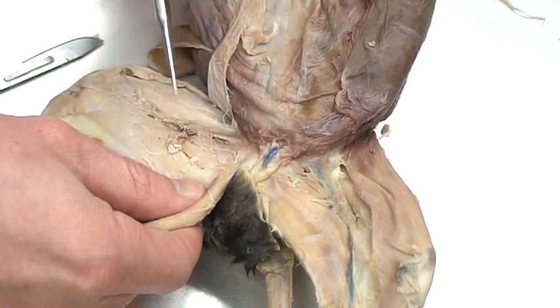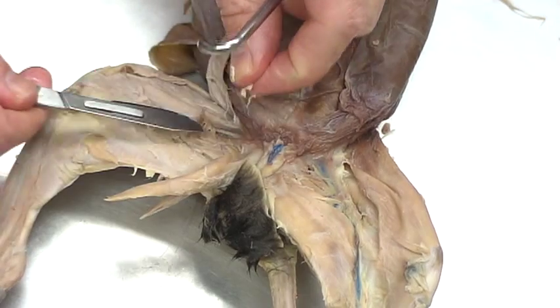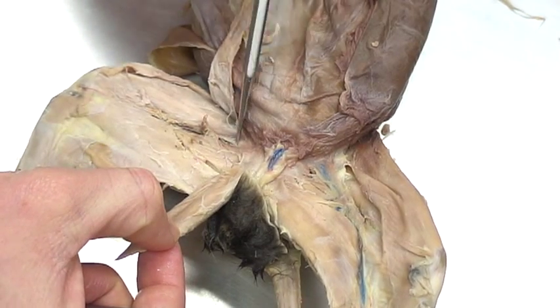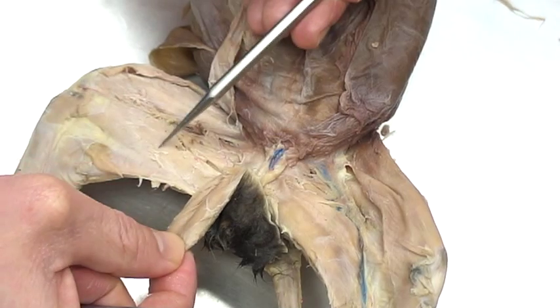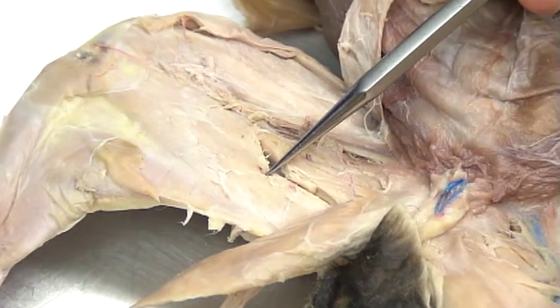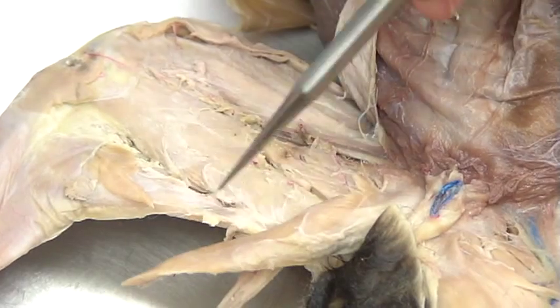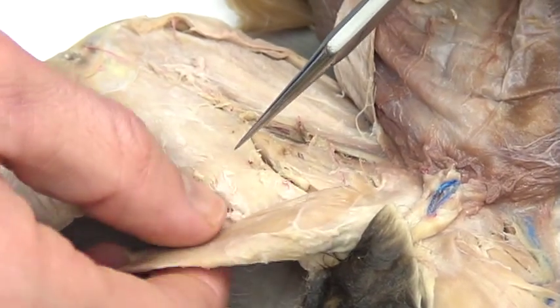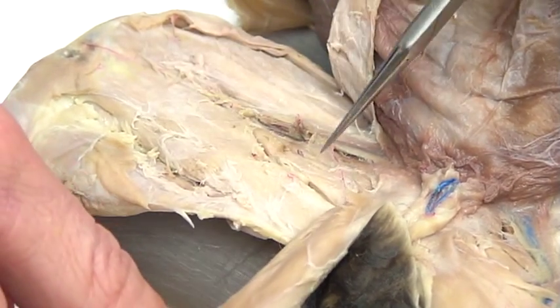There's going to be a natural break in your cats here because there are different muscles underneath. Down below the gracilis is going to be the semimembranosus. It's best identified from the medial side — you can see it from the lateral side, but we'll test from the medial side. This is the only view you'll need to know for the semimembranosus on the test.